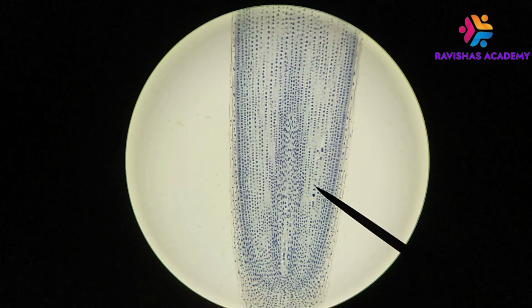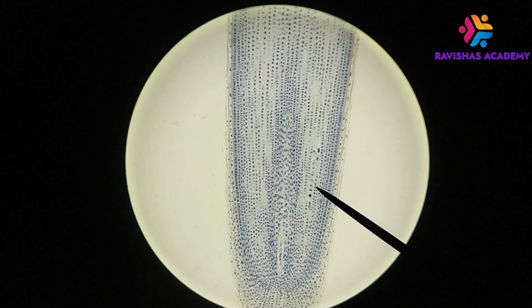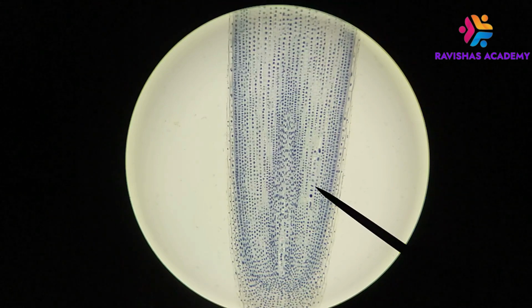There's something going on, and so at this point, I can tell that there's mitosis going on here, but if you don't know what you're looking for exactly, you might just see some differences in just little dots and squiggles and things. So let's go to higher magnification. So right now we are looking at the 10x objective, and with a 10x ocular we're magnifying this slide by 100 times. We're going to switch to the 40x objective, so we're going to be looking at a 400 times magnification in total. Okay, so here we are.